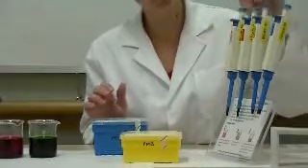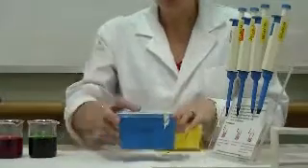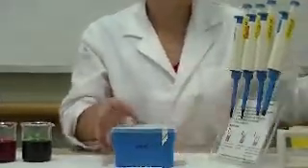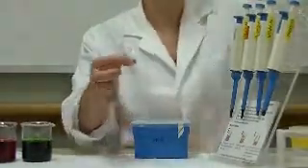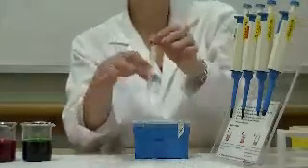So let's have a look at the different tips that you will need to use. We have the yellow tips, which go on the smaller pipettes, the 0.5 to 10, 5 to 50 and 50 to 200 microlitres. And then the blue tips, which go on the 200 to 1000 microlitres. And then finally we have clear tips, which go on the larger 1000 to 5000 microlitre pipette. These tips are often not in a container, they're just in a beaker.